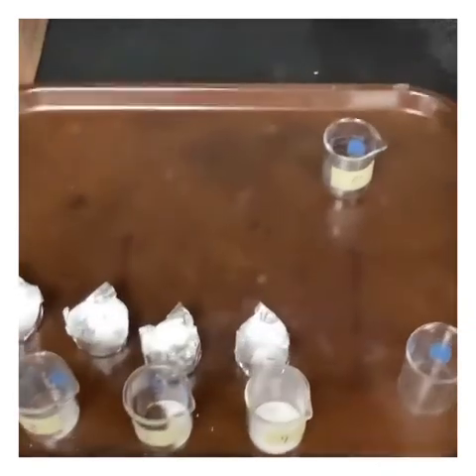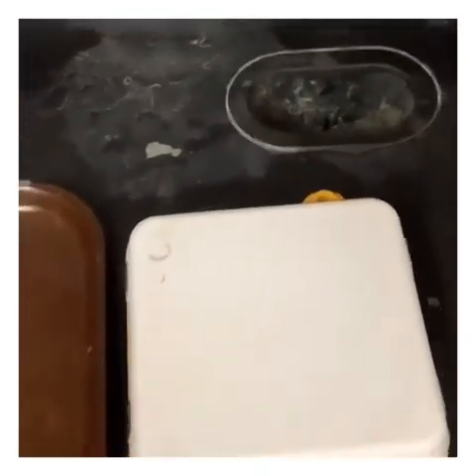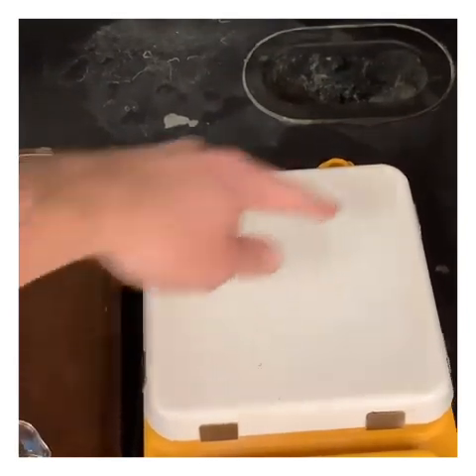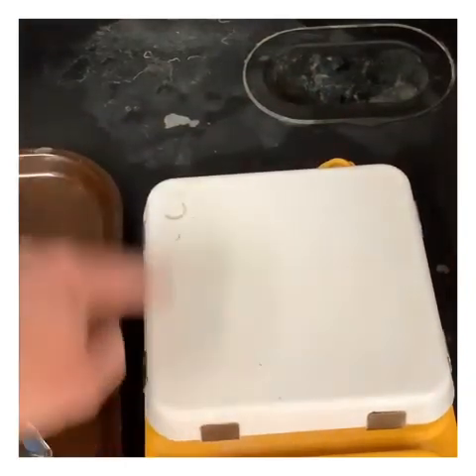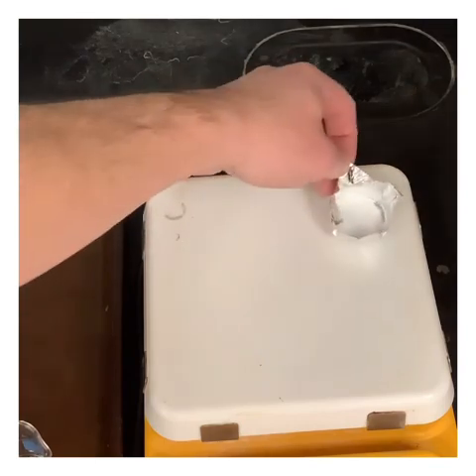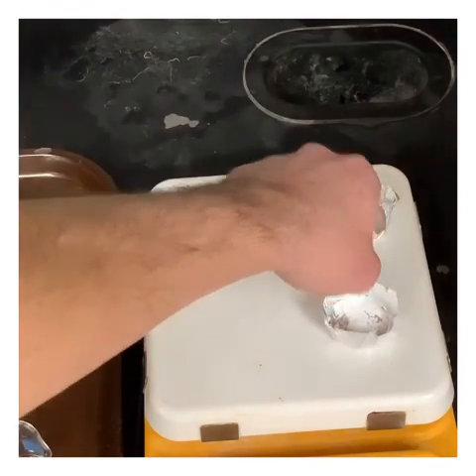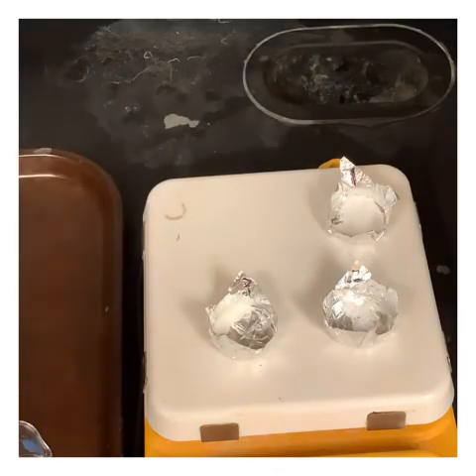We're going to go ahead and move over to the hot plate now, and we're just basically going to watch and see if these things melt. I'm just going to put them in the same locations, clockwise. So 1, 2, 3, and 4.